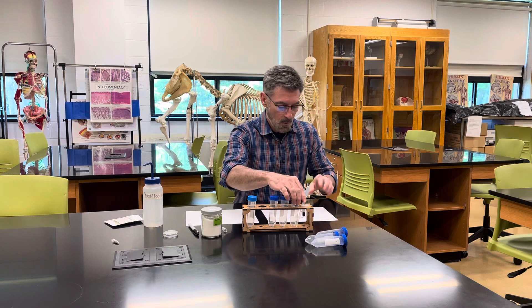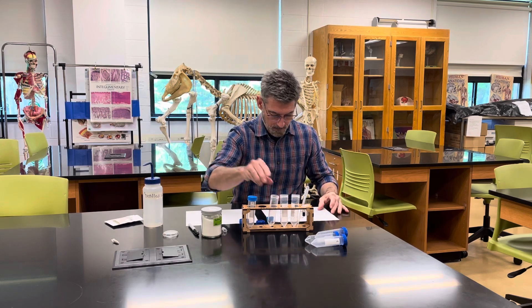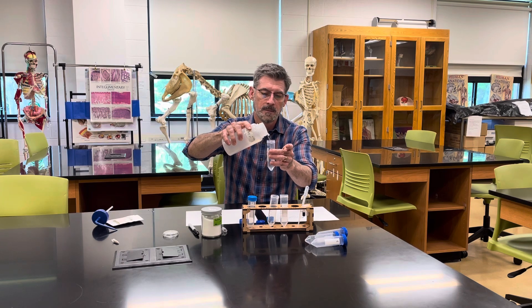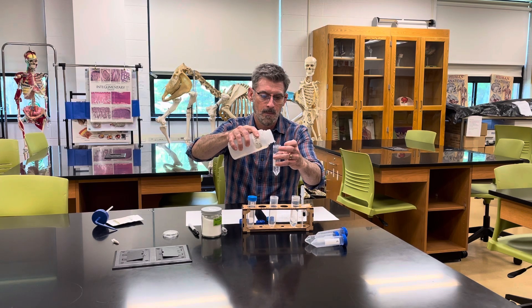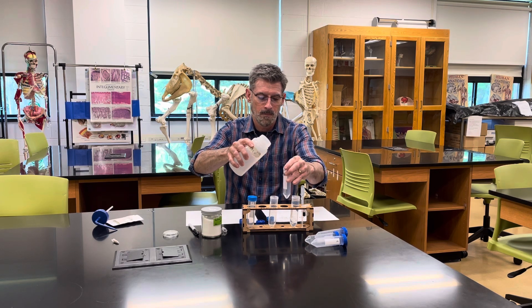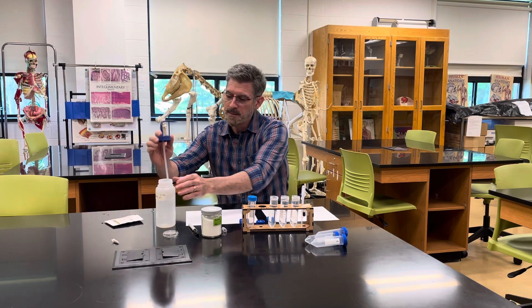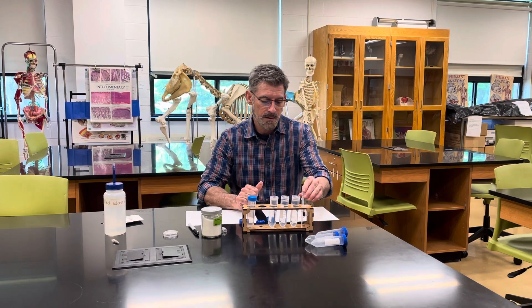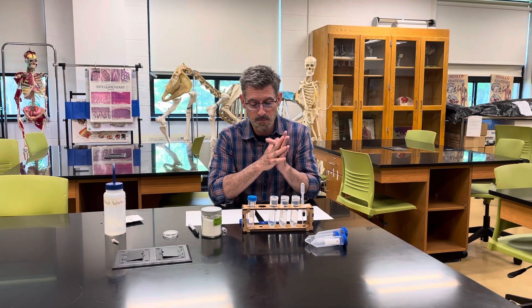First, set up the water. Each of these containers gets 50 milliliters of water — pour it in up to the 50 milliliter line. I would recommend using bottled water as opposed to tap water. Depending on where it comes from, if you have a well it's probably fine, but if it's coming from city water it could be treated and the chlorine or other chemicals could be harmful to the shrimp or their hatching success. So I would prefer you didn't use tap water.